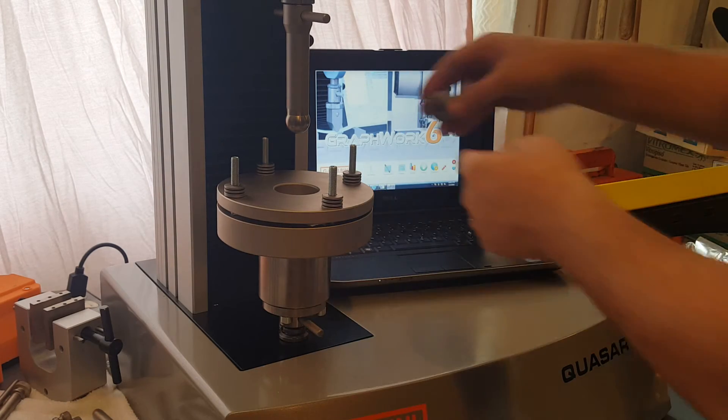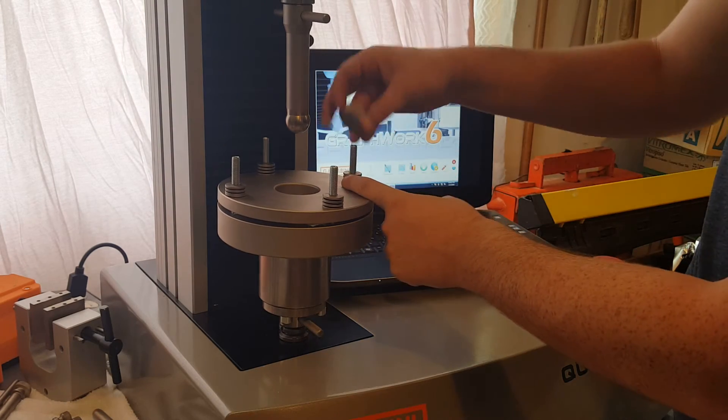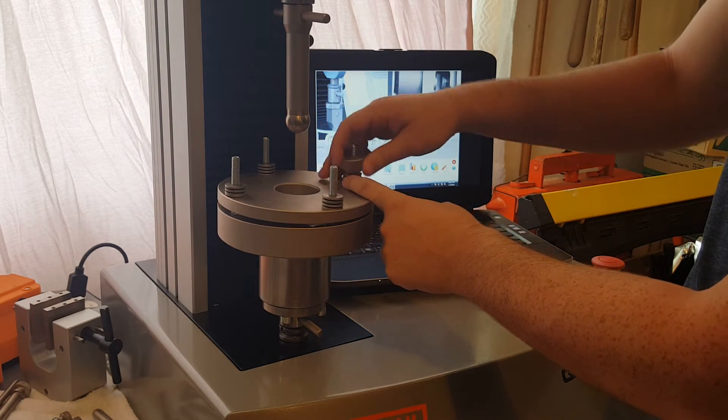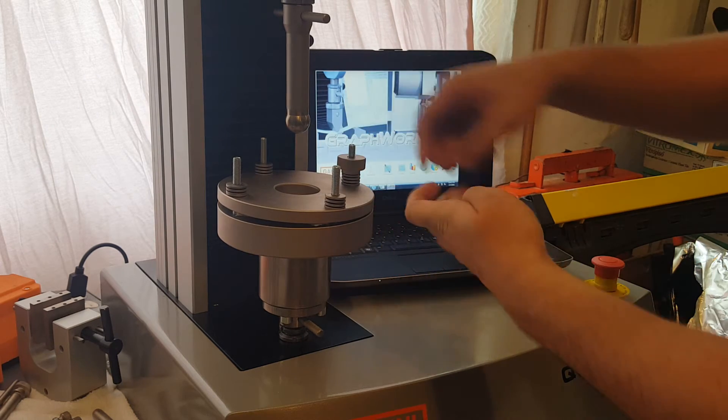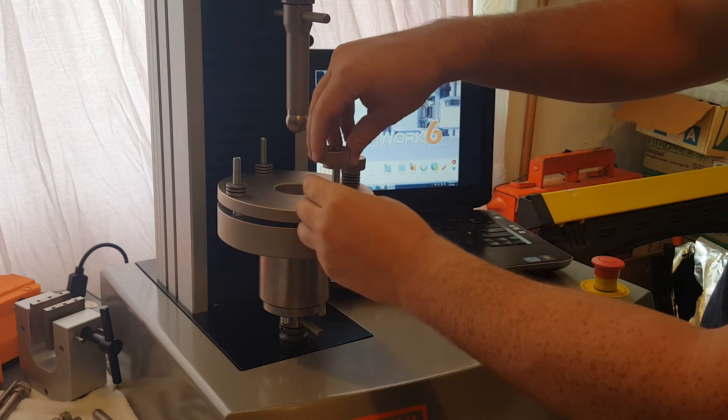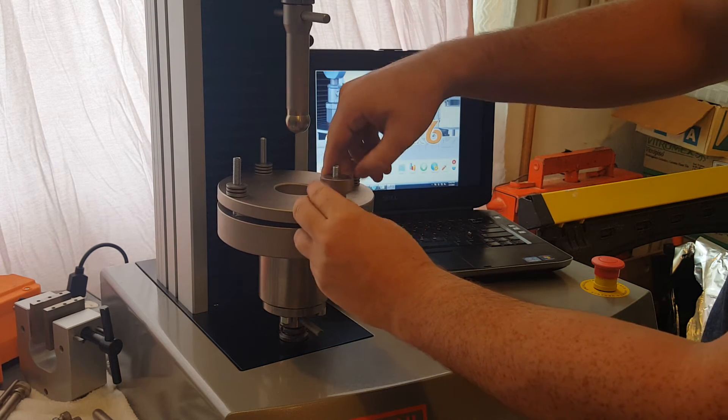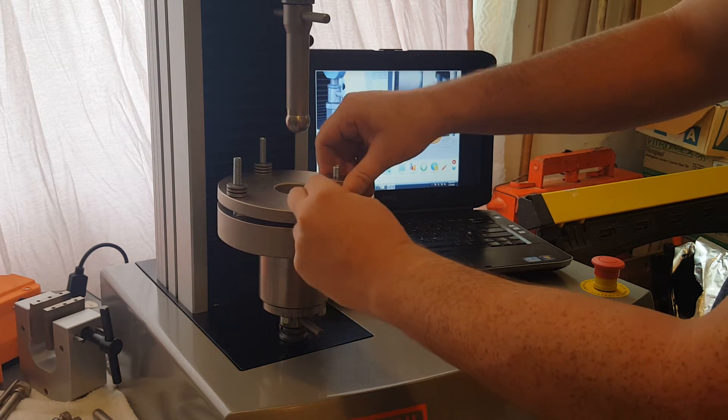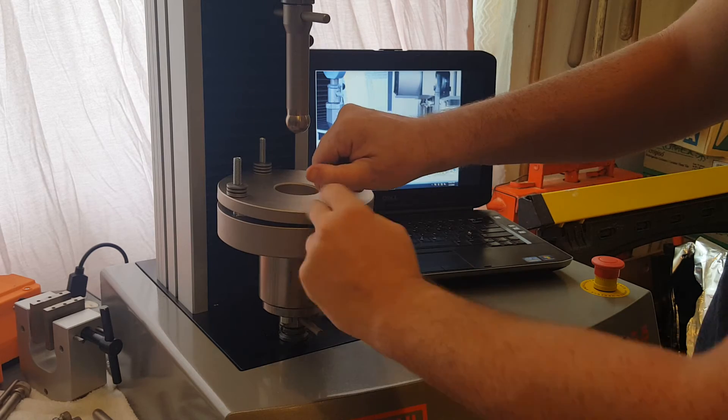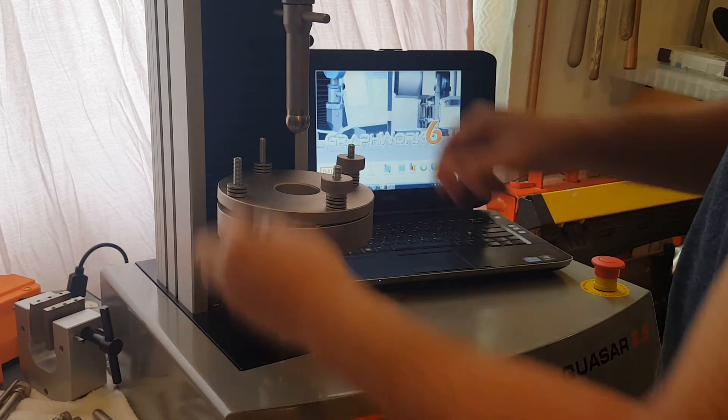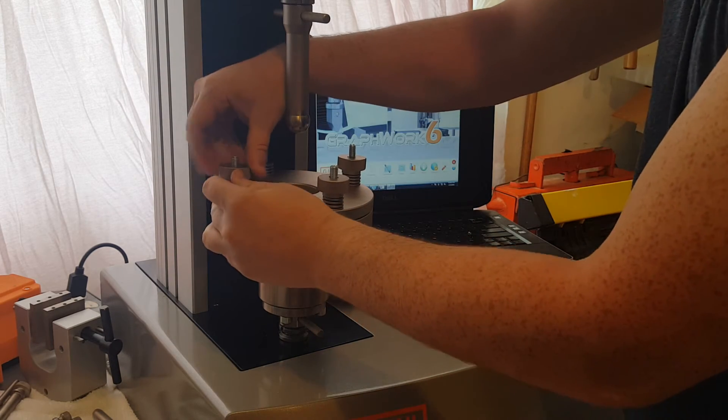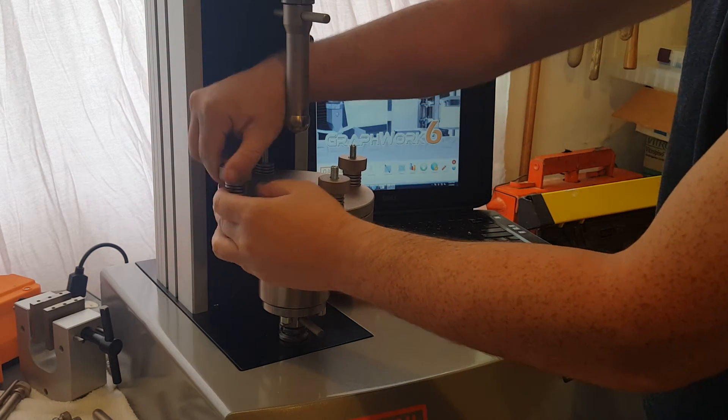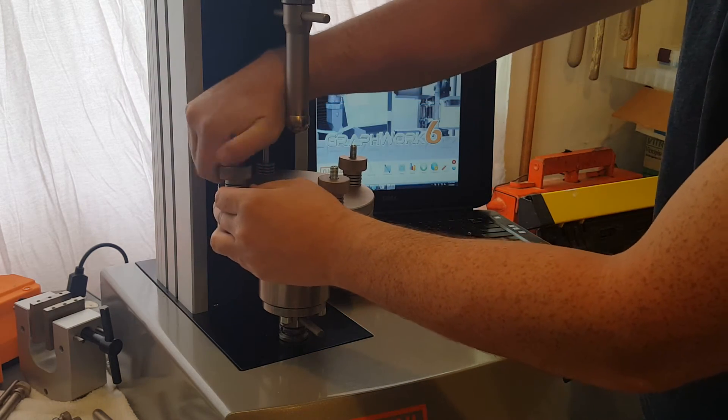Now we're going to want that nice and tight on top. So screw that down with the nuts. It's best to tighten it evenly all the way around.